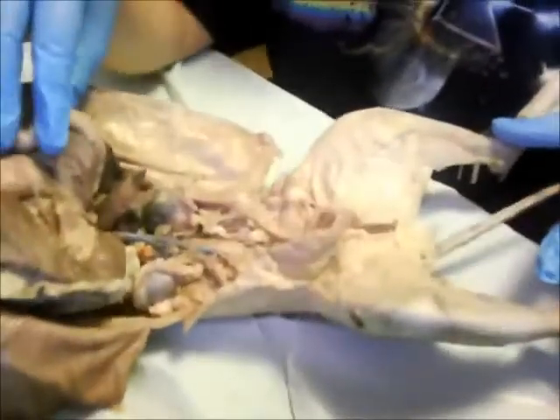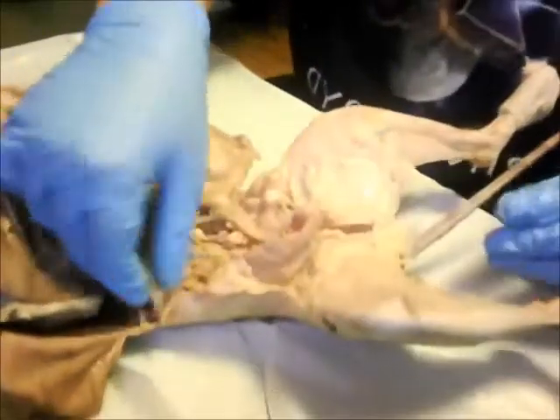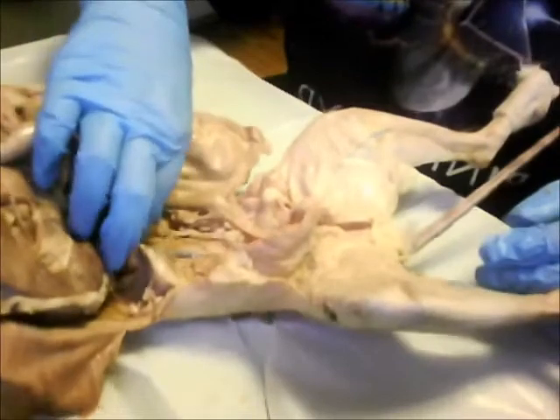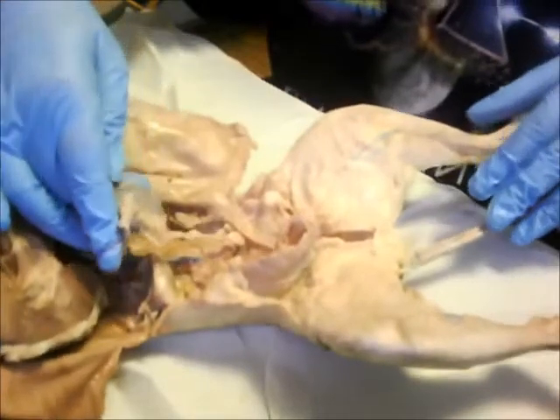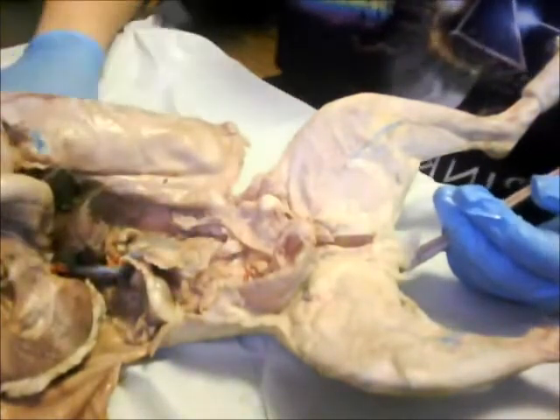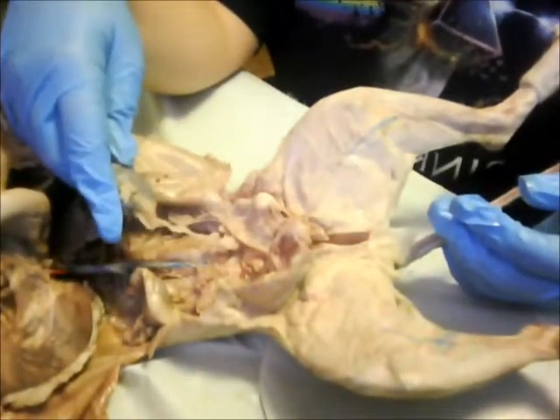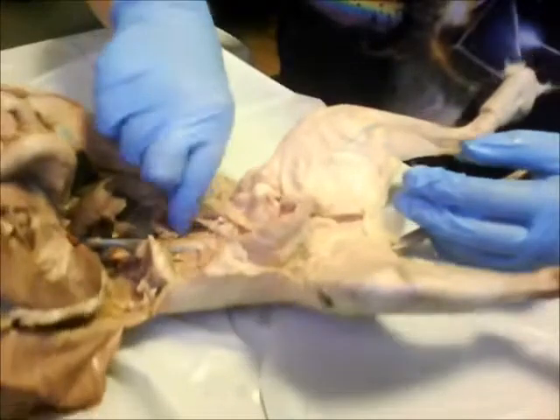Okay, going over the urinary system in cats, we have the kidneys right here. As you can see, they're very small compared to, you know, our kidneys or the sheep kidney. And then right here you'll see that there's a lot of fat surrounding the kidneys, and this is mainly for insulation and protection, mainly because the kidneys, they're not protected like the organs are around the rib cage, so they do need more protection when it comes to that.